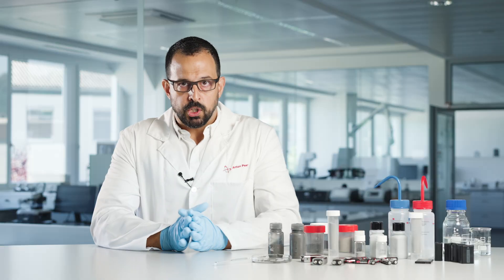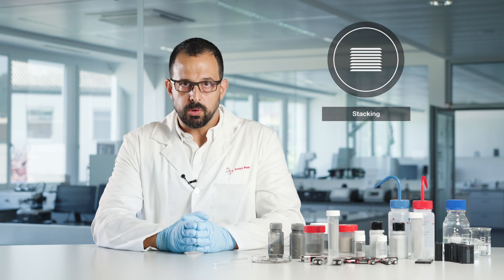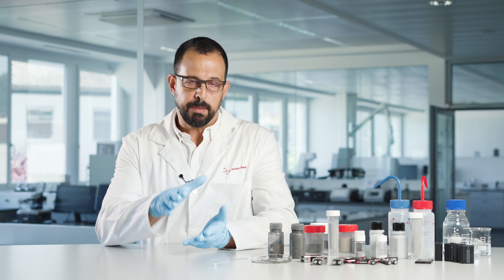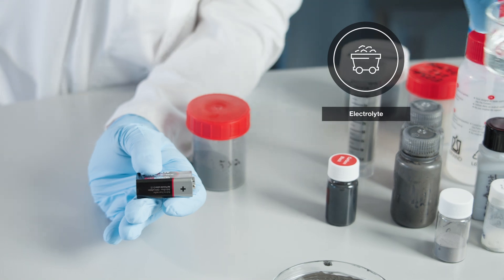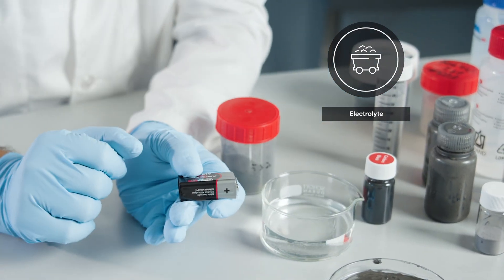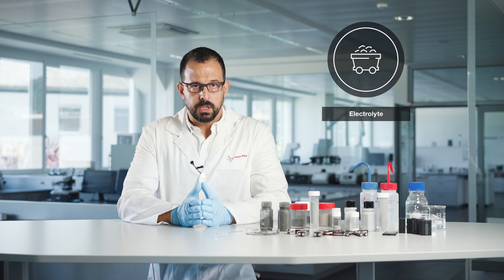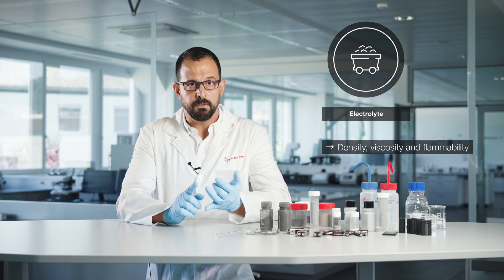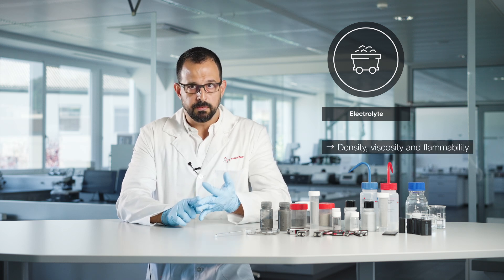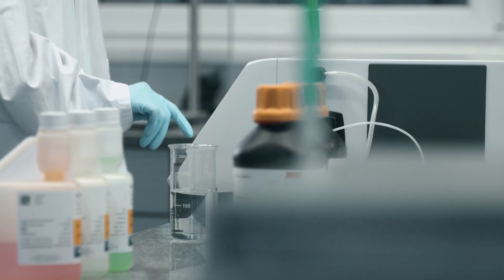In the last stages of the cell manufacturing process, after cutting and stacking multiple layers of electrodes and separators, everything is packed together into an enclosure. Then an electrolyte solution, which is a lithium-containing salt in an organic solvent, is carefully added. At this step, besides the crucially important chemical composition of the electrolytes, it is important to properly measure physical characteristics such as density, viscosity, and flammability, which are measured with a density meter, a viscometer, and a flashpoint tester, respectively.